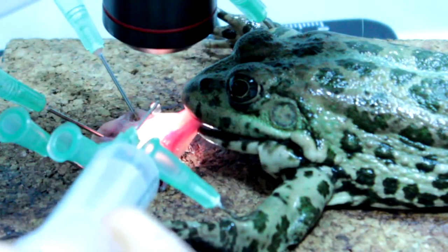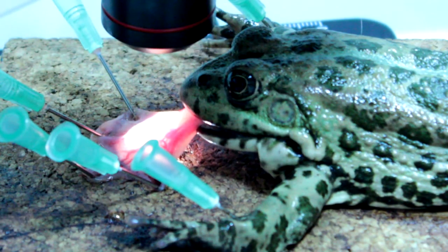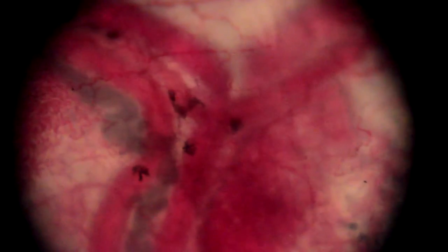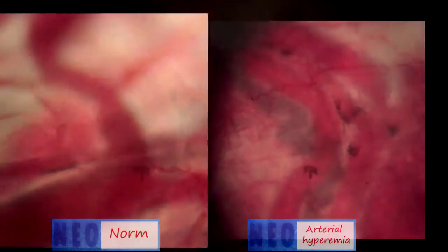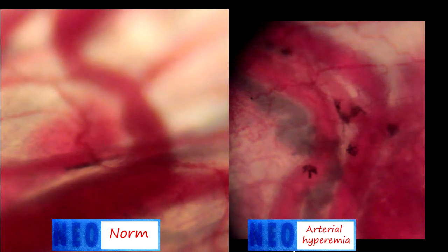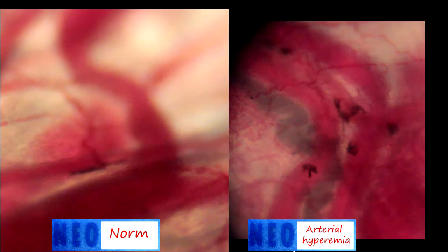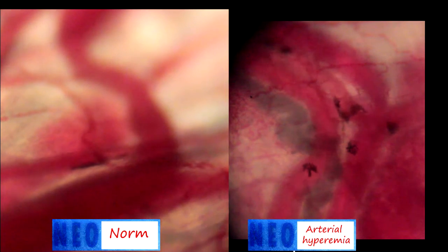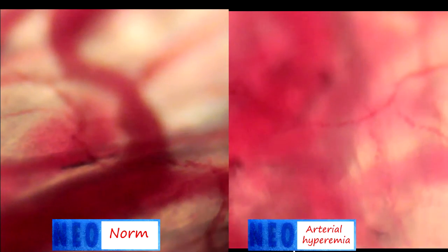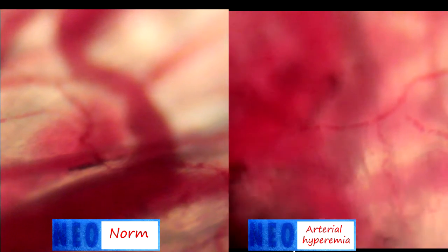Then, on the surface of the tongue, we add a drop of hydrochloric acid. A few minutes later, we see changes in velocity of blood flow, size of vascular lumen, and the number of functional capillaries. We can see that after irritation by the solution of hydrochloric acid, the blood flow velocity increases, which is accompanied by an increase in lumen of blood vessels and the number of functional capillaries. This is arterial hyperemia.